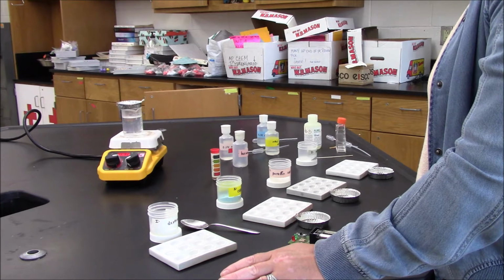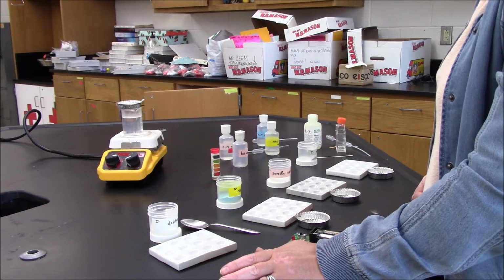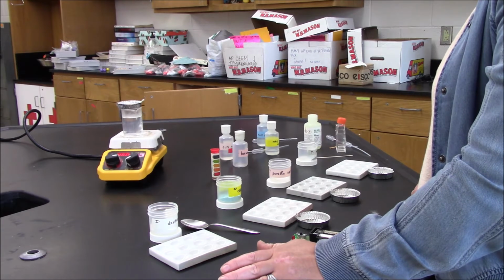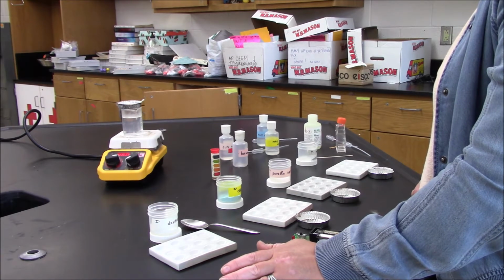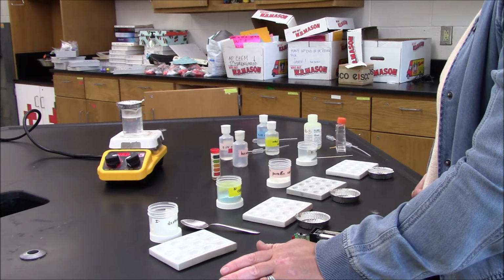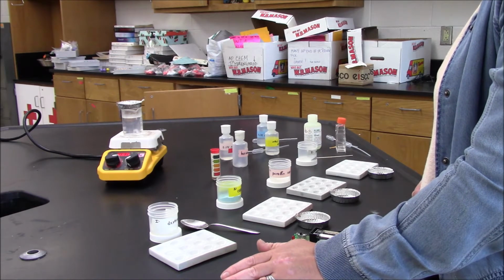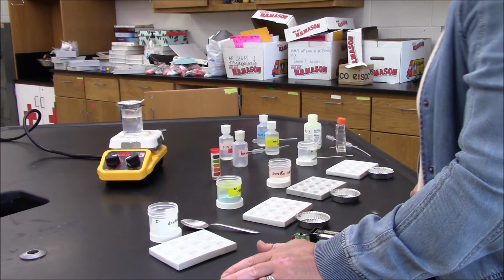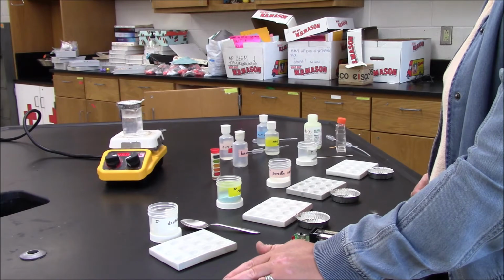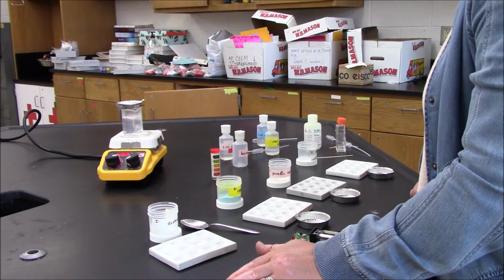we can say here is that the solid either melts at under 100 degrees Celsius or melts at over 100 degrees Celsius. So in this setup, if we observe it melting, then it melts at about 100 degrees Celsius or less. And if we do not observe it melting, then we can say that it melts at greater than 100 degrees Celsius. Remember that substances with weaker molecular forces tend to melt at temperatures less than 100 degrees Celsius.